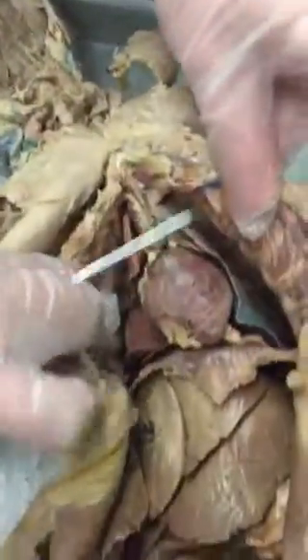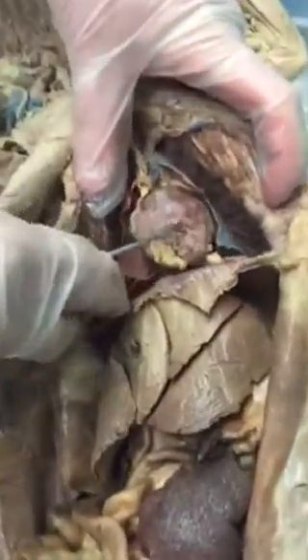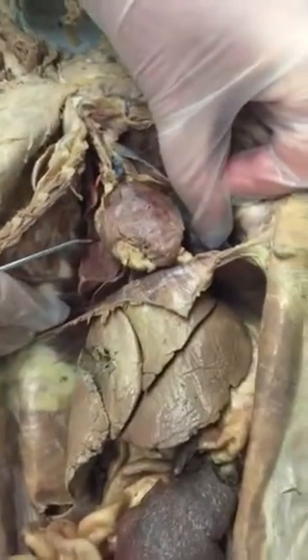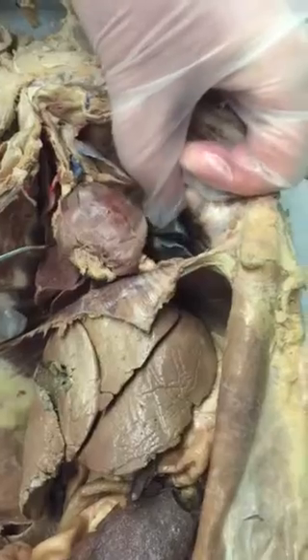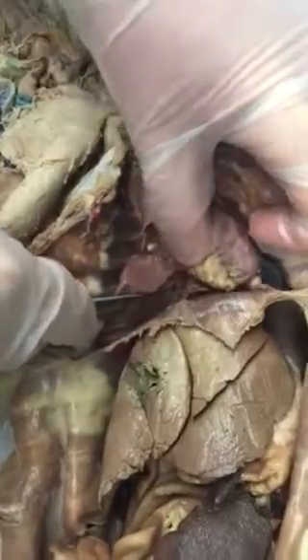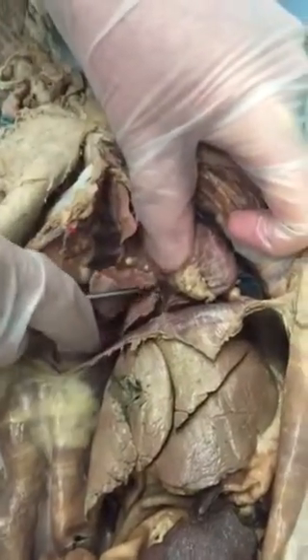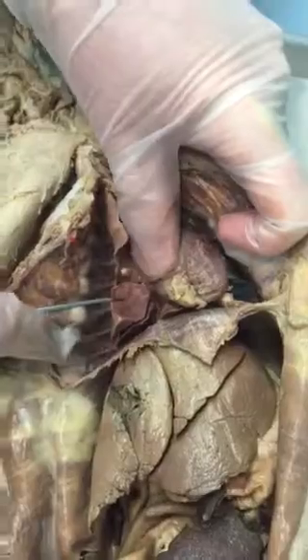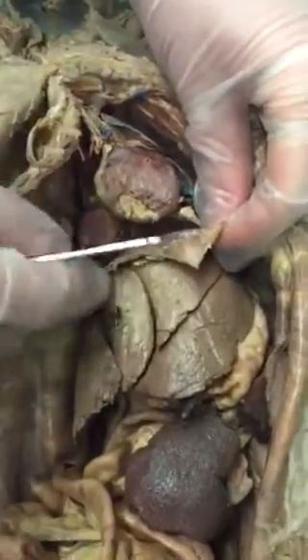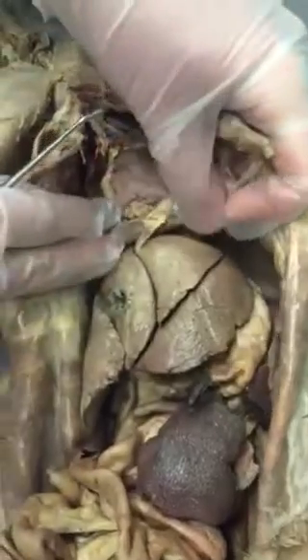And then if we go into the thoracic cavity, of course, we have the heart in the middle, the mediastinum. We have the left lung, which in the cat has 3 lobes, 1, 2, 3, and the right lung, which has 1, 2, 3, and there's a 4th lobe down here. You just have to know right and left lung. This is the diaphragm, right? Remember, the muscle that separates the thoracic and abdominal cavities.